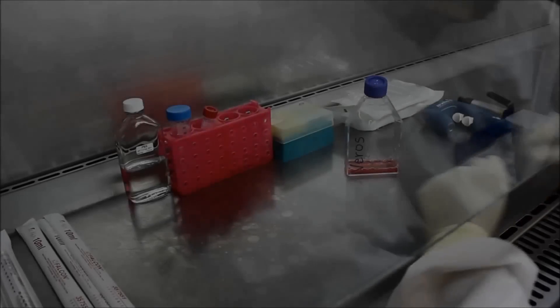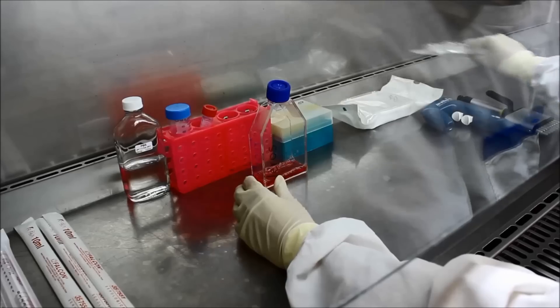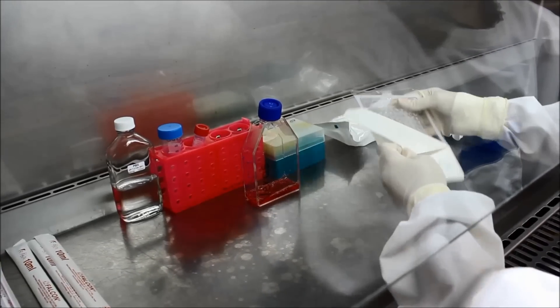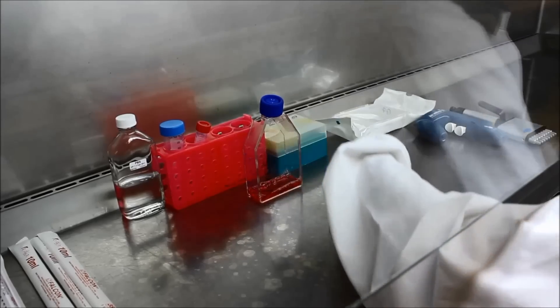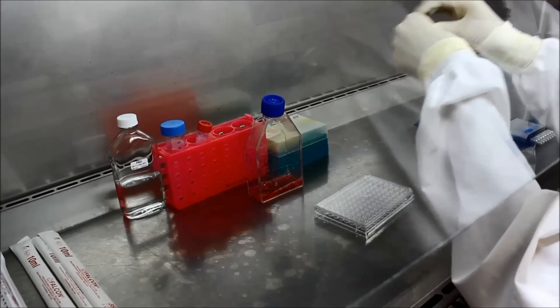TCID50 Preparation. After trypsinising your cells, you are ready to prepare your 96 well tray for the TCID50. Have all your materials arranged neatly in the biohazard hood ready for use.